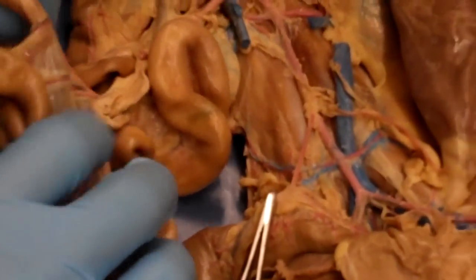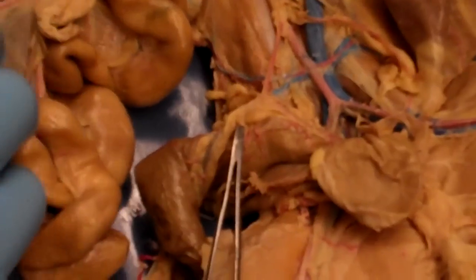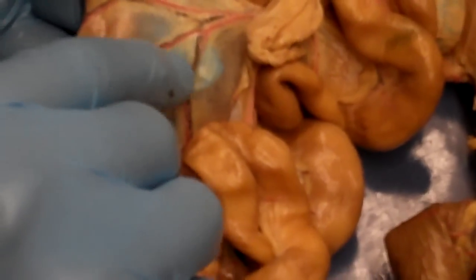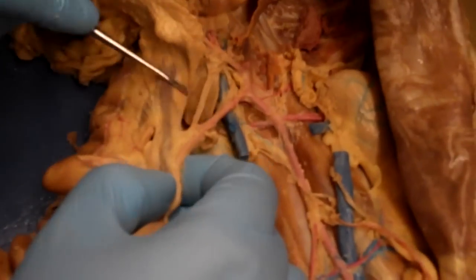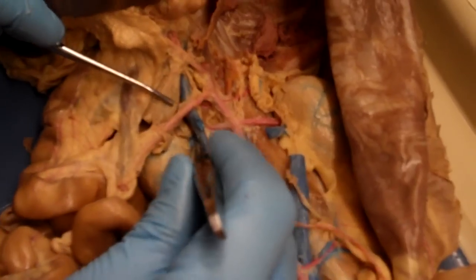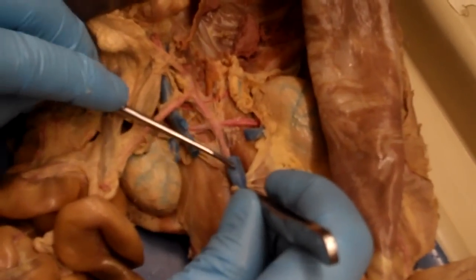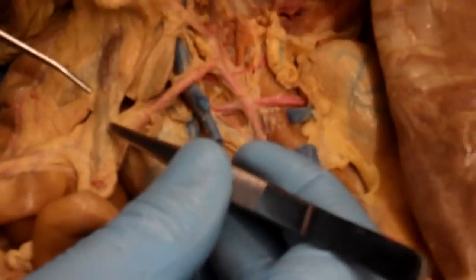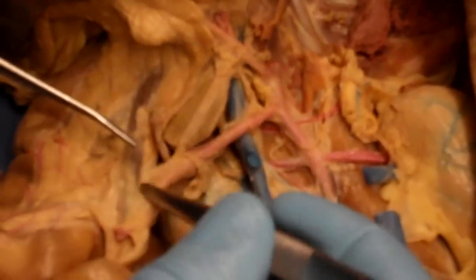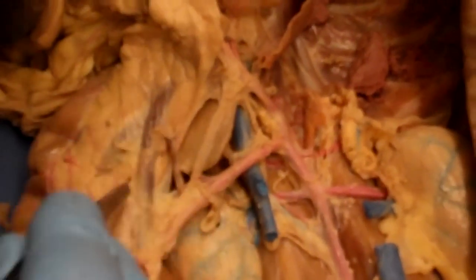So if we follow, we can see in the small intestine here, we can see these nice injected arteries, and we can see these darker veins right here. And if we follow these veins, you can see we get to the structure right here, which looks just like a large sort of uninjected vein. And you can see right here, this is the inferior vena cava right here. You can see it has blue latex. But we have this set of veins right here, which are uninjected. That's going to be that portal vein.